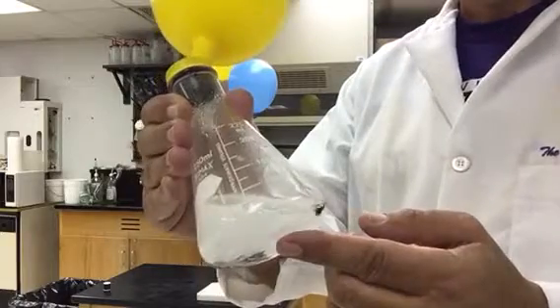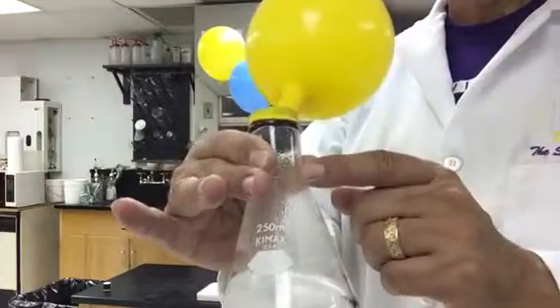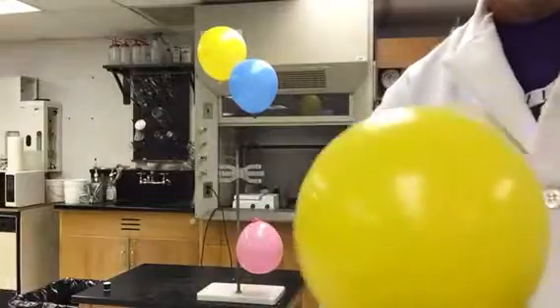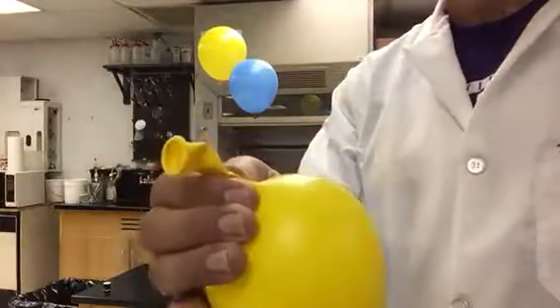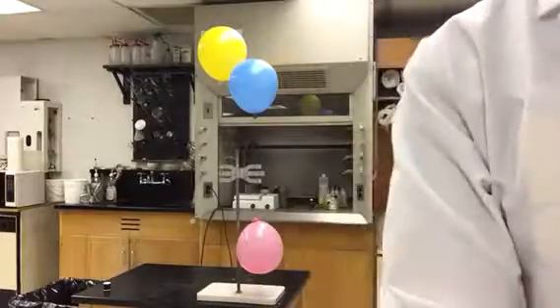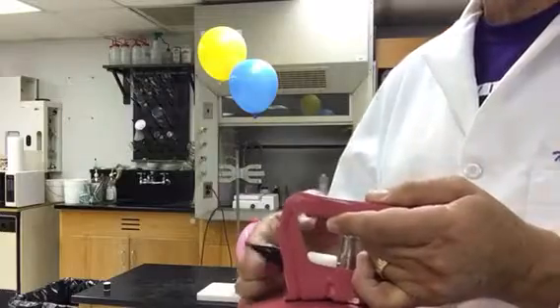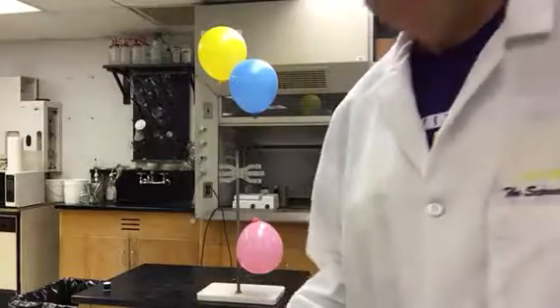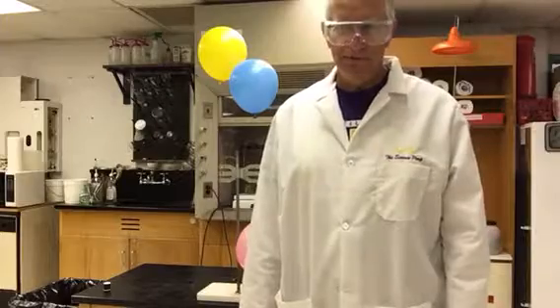In this flask, I put hydrochloric acid and zinc, and it's generating hydrogen gas as one of the products of the chemical reaction. The hydrogen gas is colorless. Watch, you see nothing coming out of the balloon because it's colorless, it's odorless, just like helium. The helium I got out of a commercial tank just to demonstrate that again. You see no color, you smell nothing. So in a physical sense, they're very, very similar, but they have a very big difference in their chemistry.